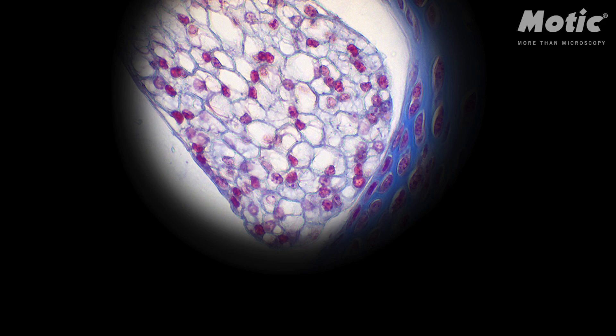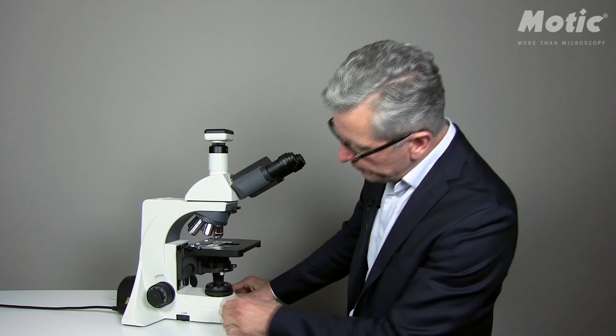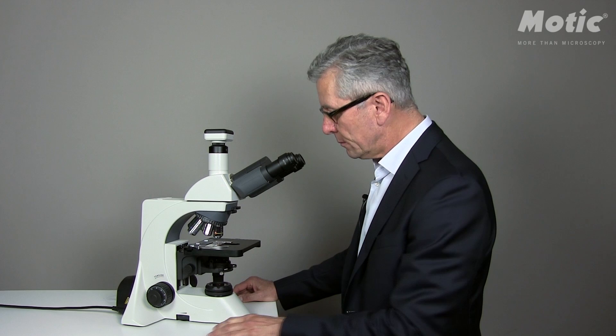The field diaphragm is an integral part of every Köhler setup. It is built in at the base of the microscope. You have to close it until the edges of the field diaphragm are visible in your eyepieces. Now please focus the image of the field diaphragm to the point where the image is getting sharp, meaning that the edges of the field diaphragm are as sharp as possible.